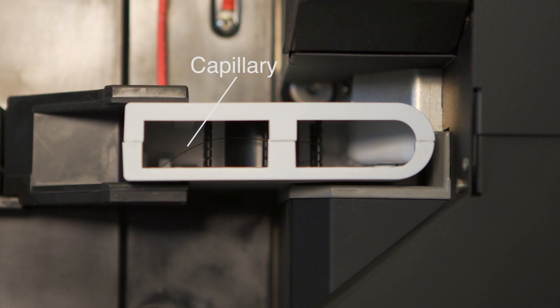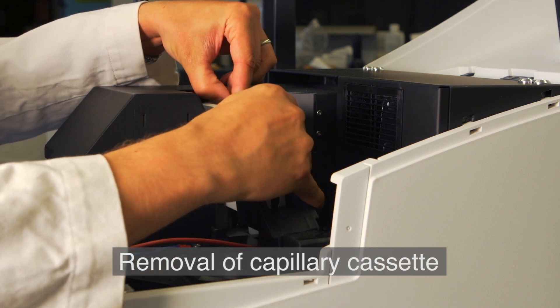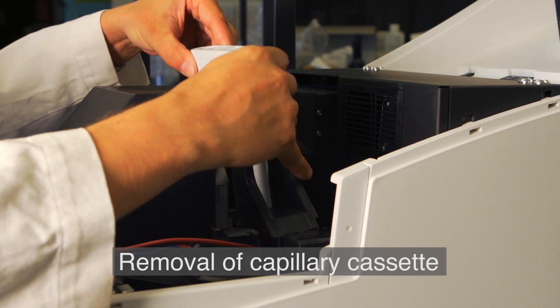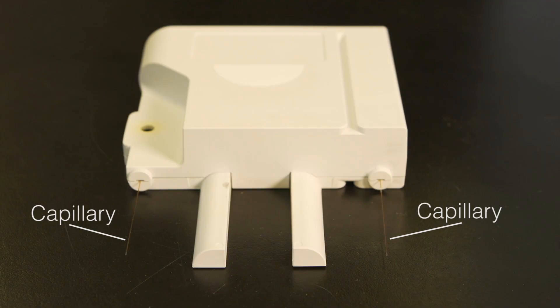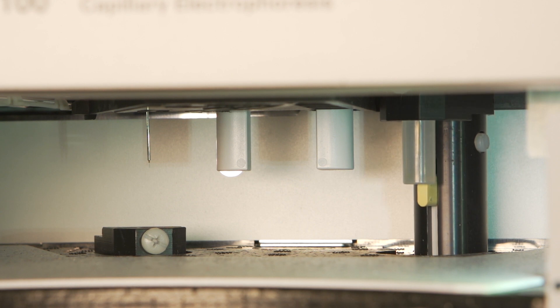The capillary itself is coiled up inside a plastic cassette. Before measurements begin, the sample needs to be introduced into the capillary.